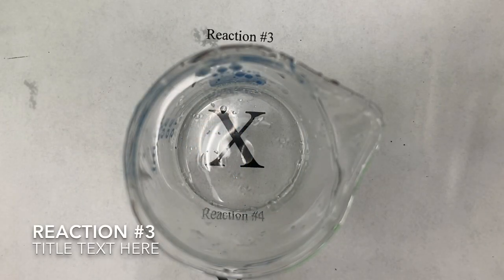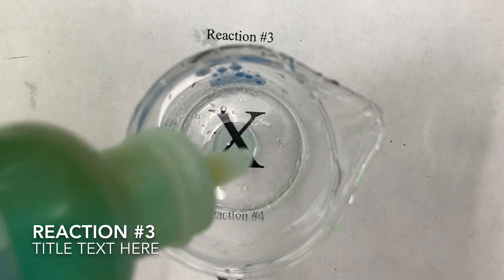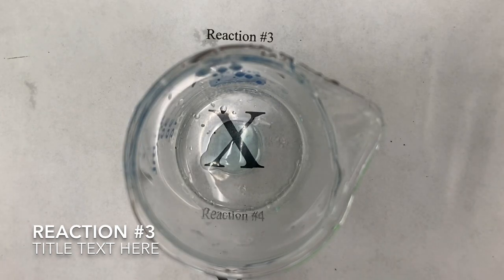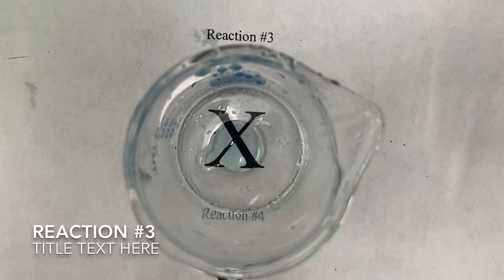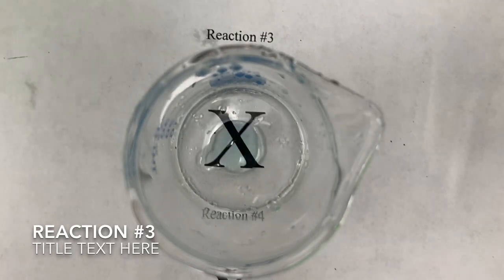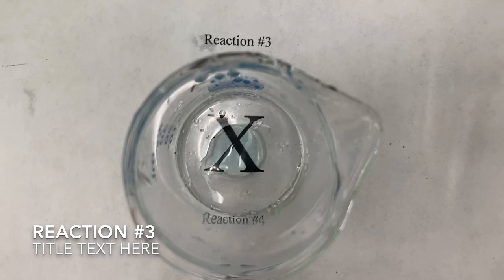All right. For reaction number 3, we're looking at which way equilibrium shifts when I add ammonia to copper sulfate. So I'll start with a drop or 2 of copper sulfate. It's a light blue color. I want you to predict what's going to happen if I add 1 drop of ammonia. Keep in mind this is the same as adding hydroxide. It has the same effect as adding hydroxide.